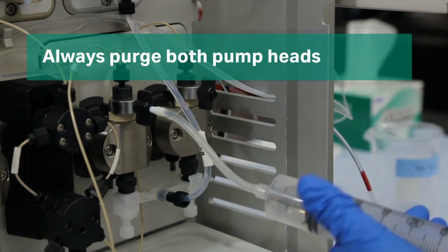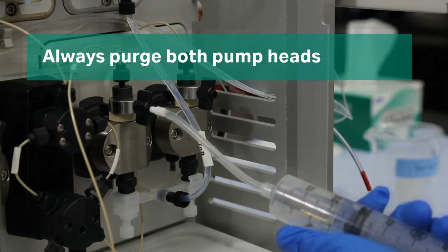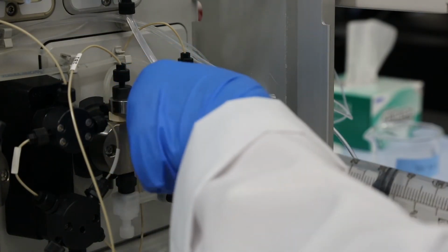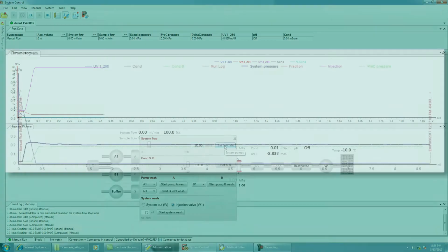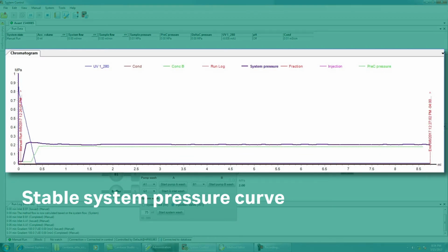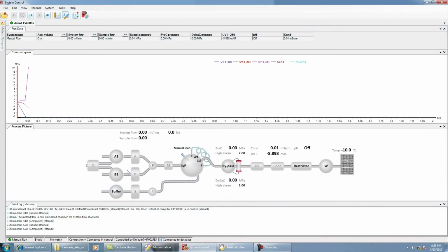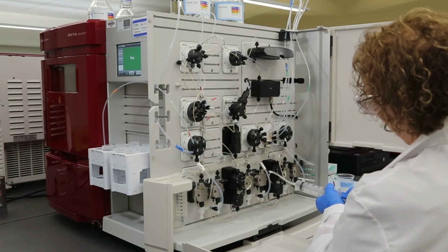It is very important that you always purge both pump heads when priming the pump. When you are finished, ensure both purge valves are tightly closed. Set a flow rate and check the flow coming from the waste line to see that it is even and consistent. The pressure curve should also be stable. In UNICORN, repeat the buffer inlet selection process for each line you wish to prime. As before, use a syringe to completely remove all air from the buffer line and both pump heads.